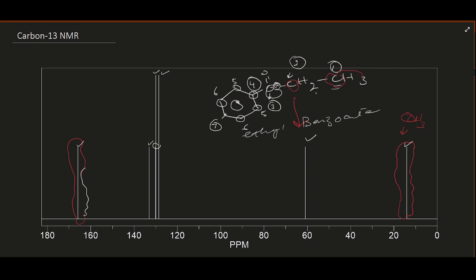There was a mistake in my molecule, because the carbonyl shift is higher than that, so I identified from the spectrum that there is a mistake in the molecule. I had not written the O, so there is an ester group. So this is the ester group peak, and there are 7 different peaks, meaning there are 7 different types of carbon in our molecule.